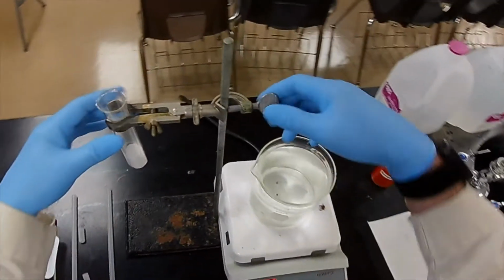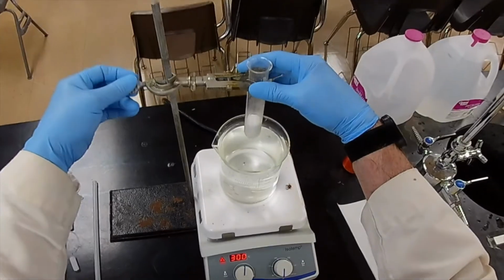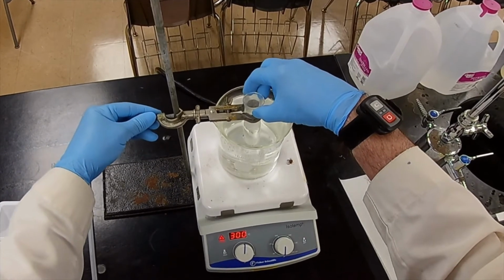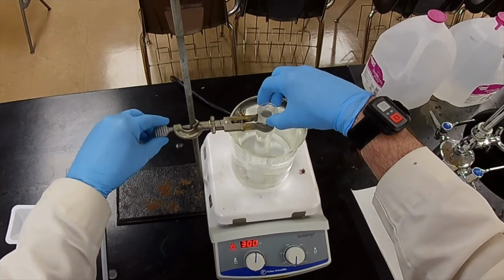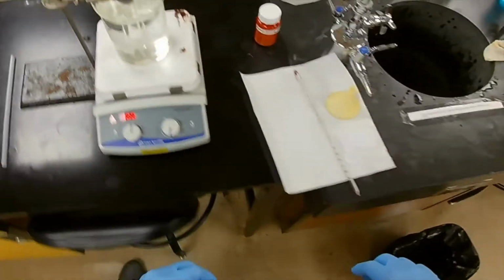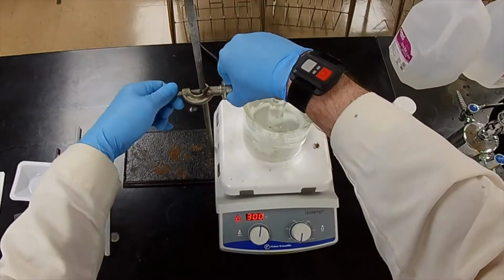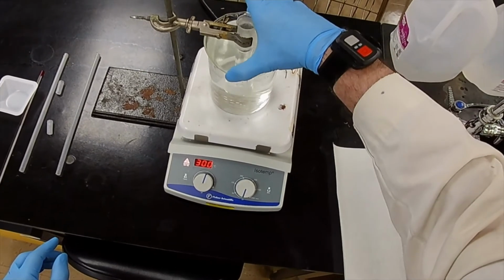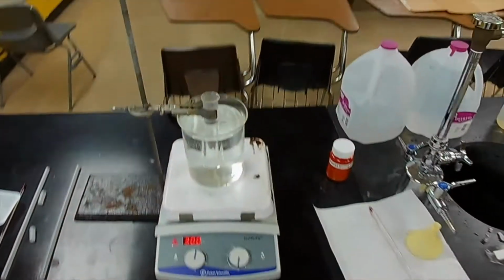All right, so let's start heating this. The water is sufficiently warm. Just lower it in, and we go as deep as we can, like this. And hopefully we don't have to clamp it down really tight, just to stabilize it. And what we may notice, let's adjust that just a hair. Let's get the writing on this beaker out of the way so you can actually see inside the beaker.